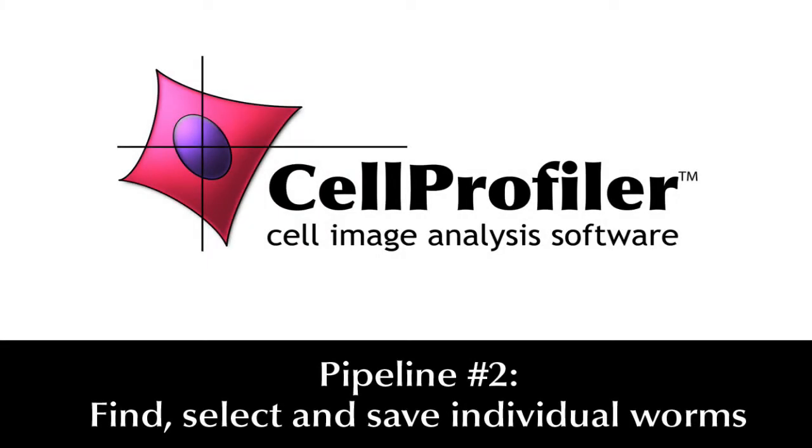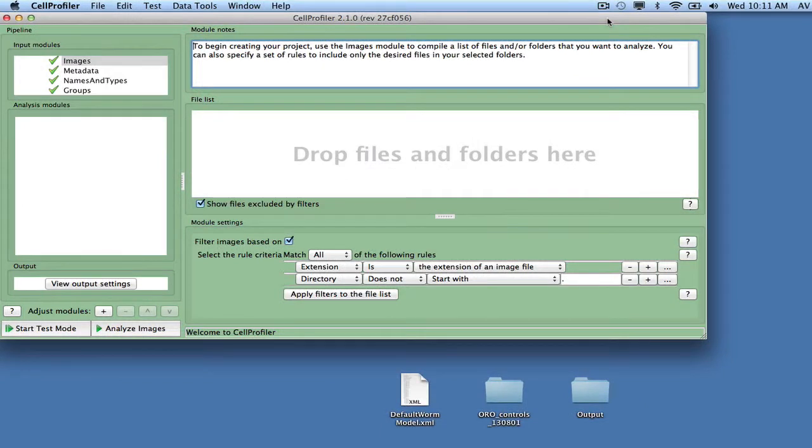For this tutorial, we will be building a pipeline to find and select worms for creating a worm model. This is the pipeline you would want to run if you are creating a model for the first time, and can be omitted if a previously created model fits new data.